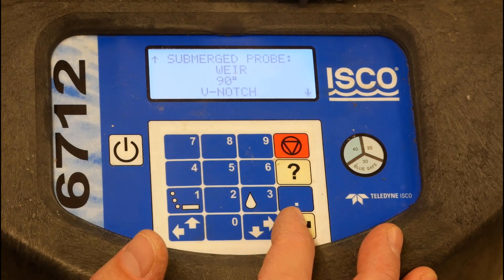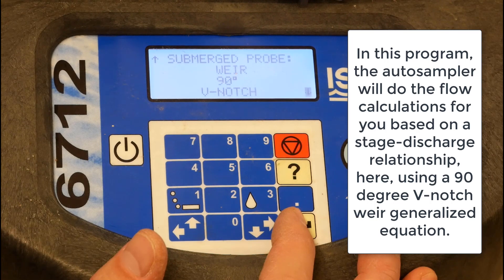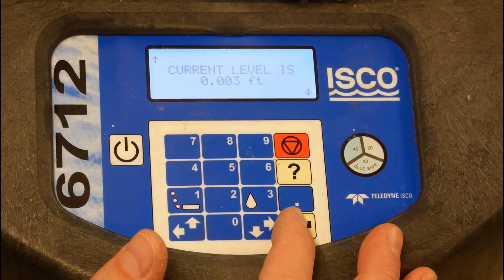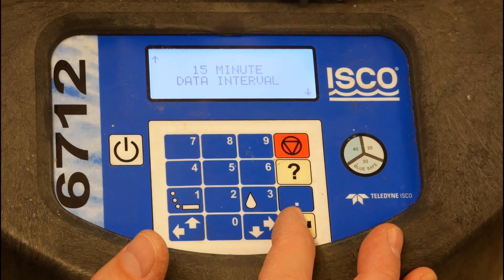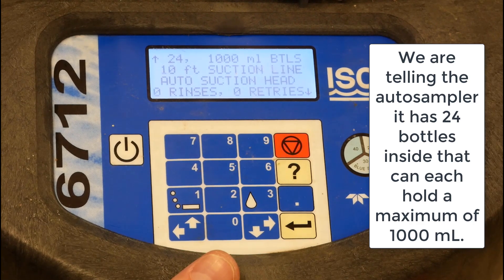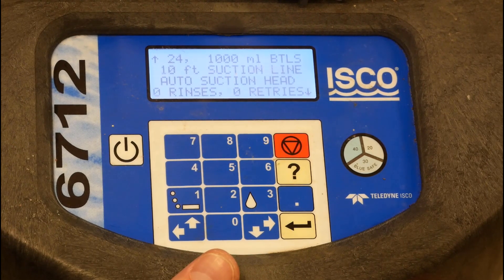We're looking at using a submerged probe — our 720 module — and calculating the flow through a 90-degree V-notch weir. We're reporting out our current level based on our pressure transducer reading. We're going to use a 15-minute data interval, so information is collected every 15 minutes. We have a 24-bottle configuration; each of these bottles are 1000 milliliters, and we have 10 feet of suction line.